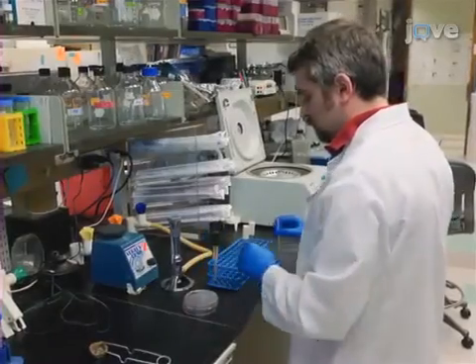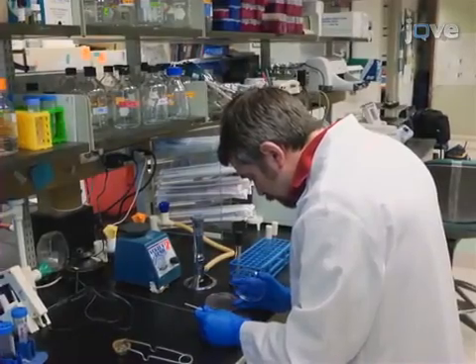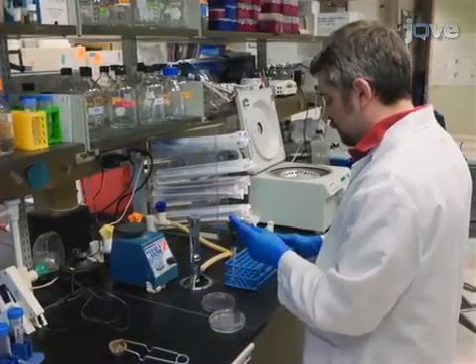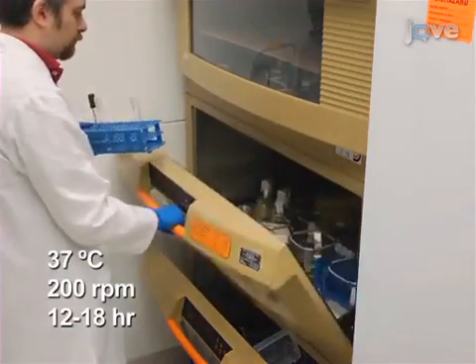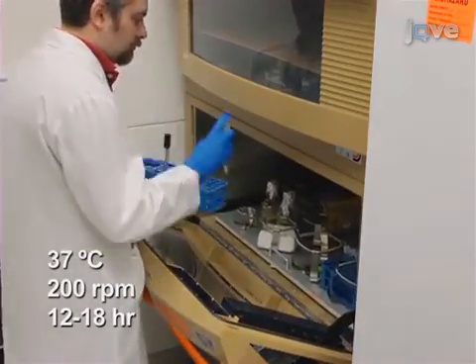To grow bacteria for LPS extraction, set up an overnight culture of gram-negative bacteria in 5 milliliters of LB, supplemented with antibiotics if necessary. Grow the culture overnight in a shaking incubator at 200 RPM and 37 degrees Celsius. Use LB to dilute the culture.